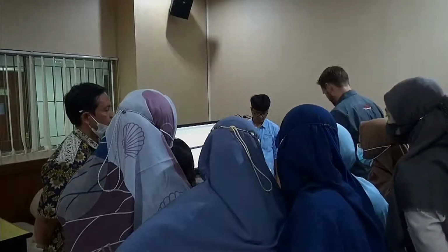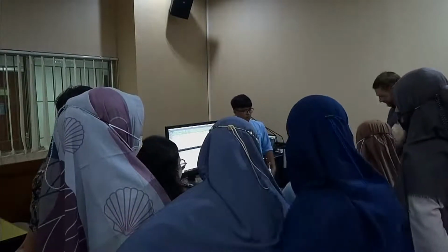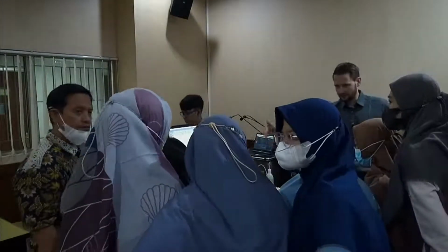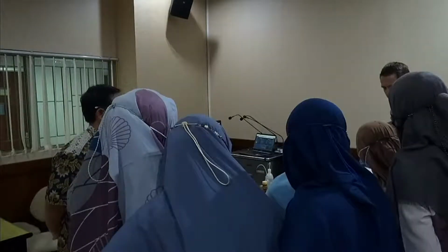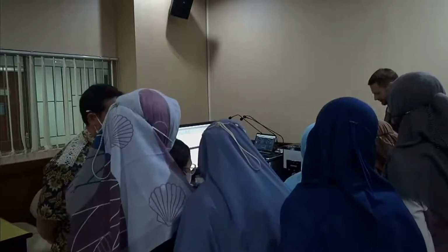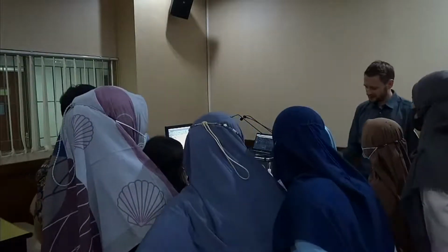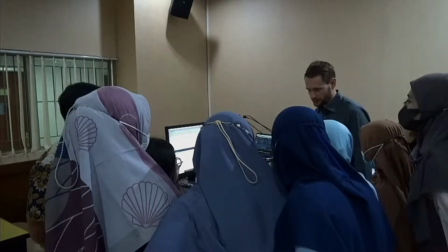So let's change that. I was talking about the accessories with the tools to fix the water. We'll also have a USB stick for software, basically. If your software gets lost, you have the installation files there. You can install it on multiple computers. You'll have this, which we will use in 10 minutes, and you'll have this. So this is our internal standard F500. It's not a NIST traceable standard, so make no mistake. NIST traceable standards are very expensive. You can buy them from us if you want to, but there's no real need to.